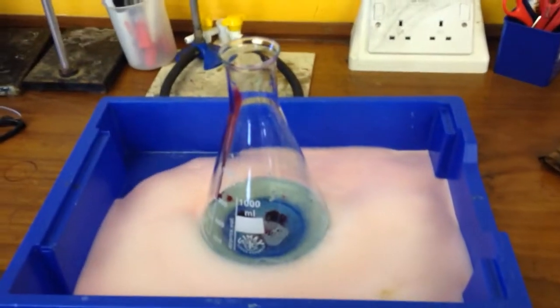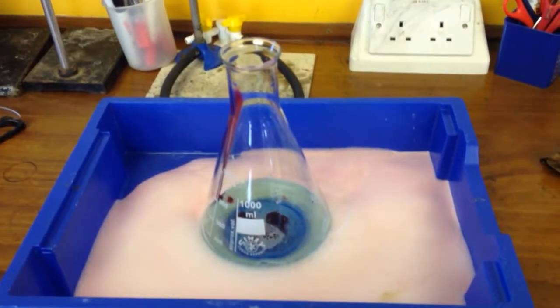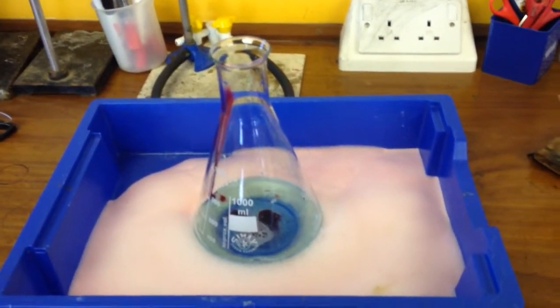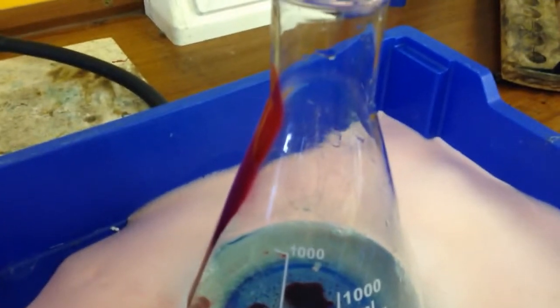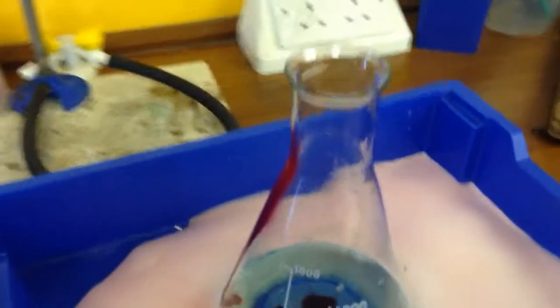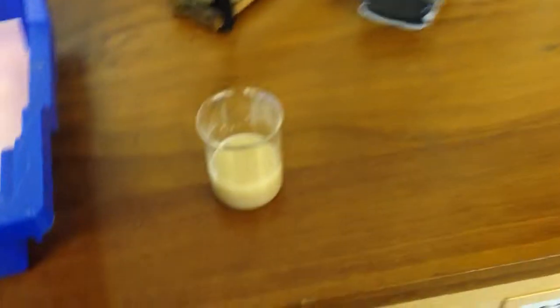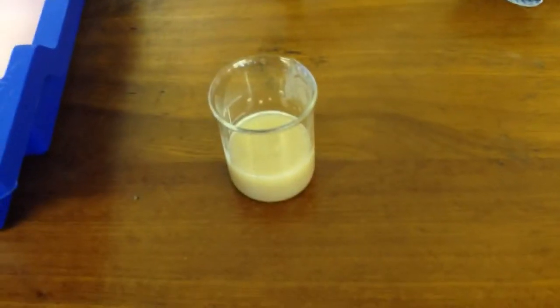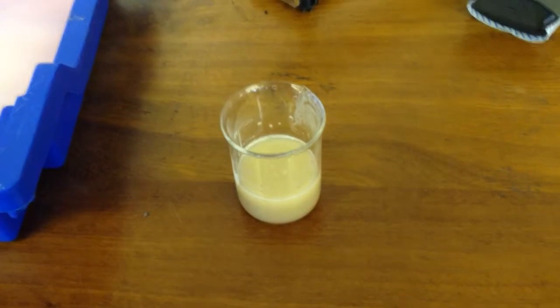I have my conical flask in here and all I've got in there is hydrogen peroxide, some washing-up liquid, and some food colouring. I've poured the food colouring down the side here so that I can try and make it stripey, so it looks a bit more like toothpaste. Over here I have some yeast in warm water which is going to give us the enzyme.